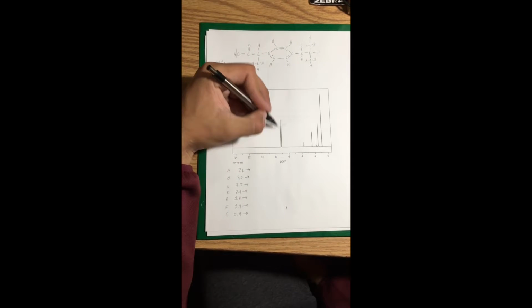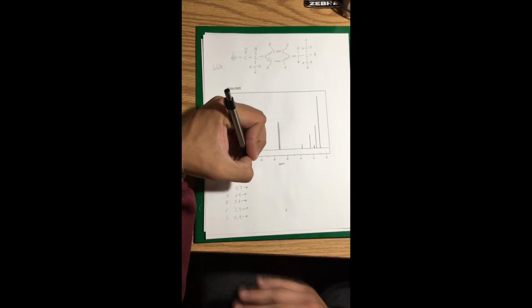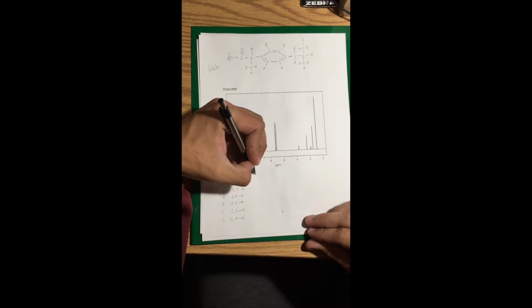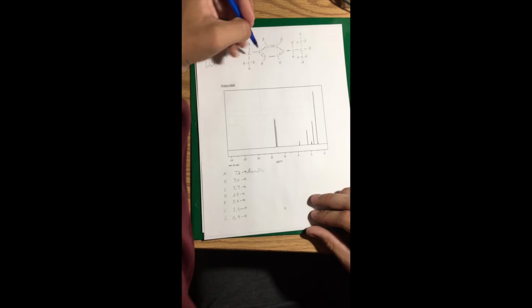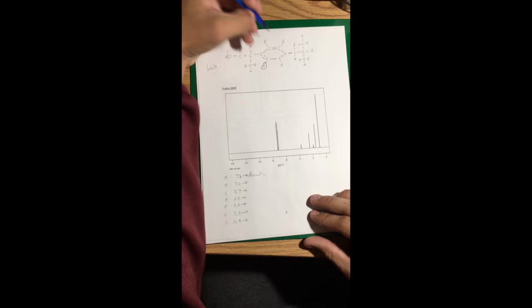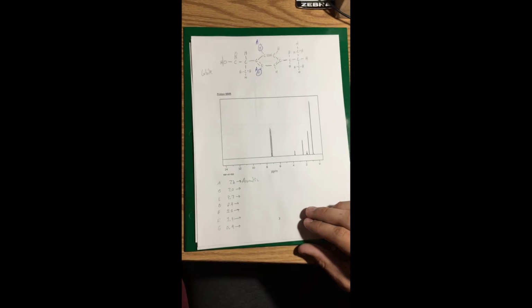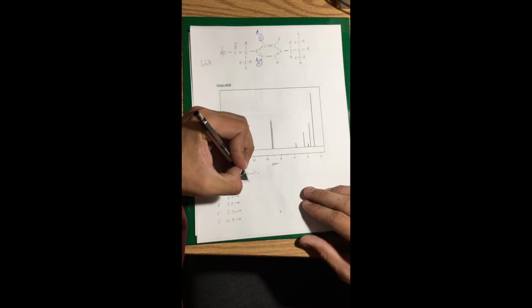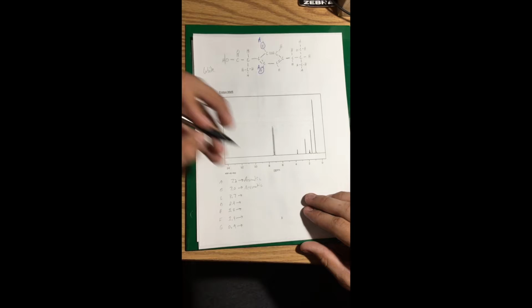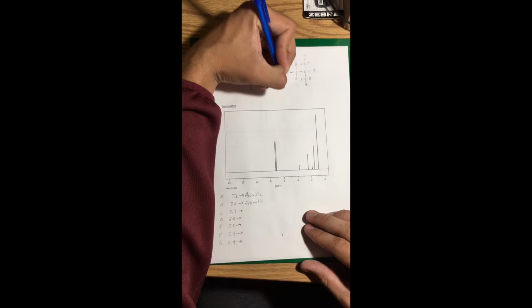This first line right here, this singlet, is coming in at 7.2, and that gives a strong aromatic signal, so I'll write that down. I'll also circle, I labeled it A, and I'll circle the 2 hydrogens that it is representing right here. I'll label them as well. Both of these are A. Work to this next one. It's just 7.0, and it's also qualified for aromatic. There are 2 other hydrogens on this aromatic that B will be covering. I'll circle them now and label them.